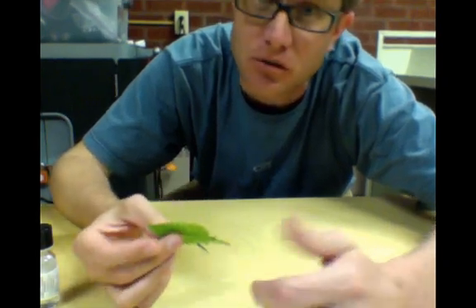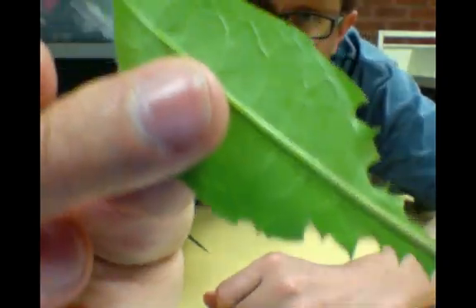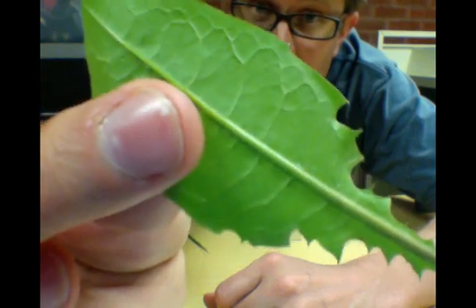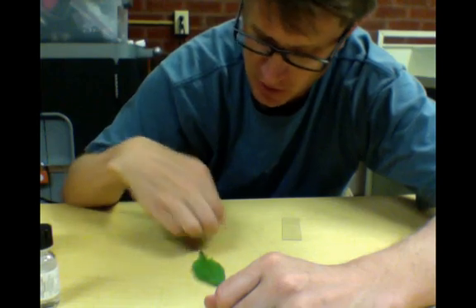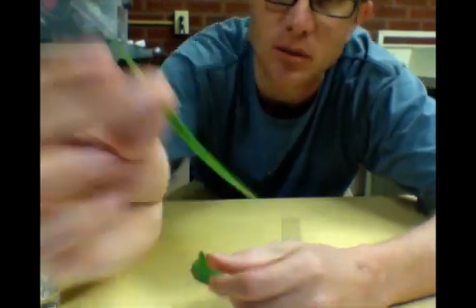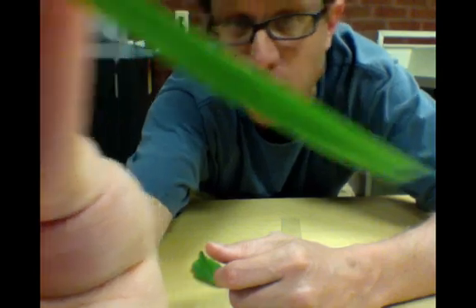I'll be using two types of leaves today. I'm going to use a dandelion leaf, which is a dicot. You can see that its veins are branching out. And then I'm going to use a monocot leaf. And this is a simple blade of grass that I just picked outside.